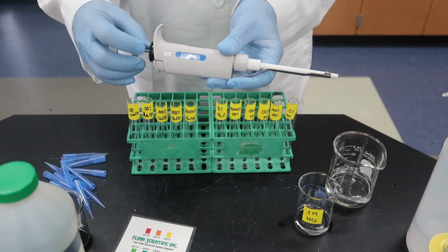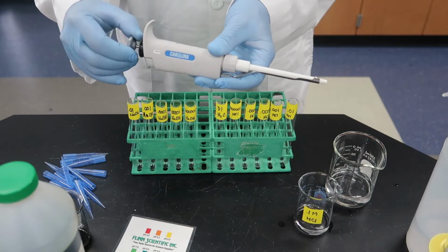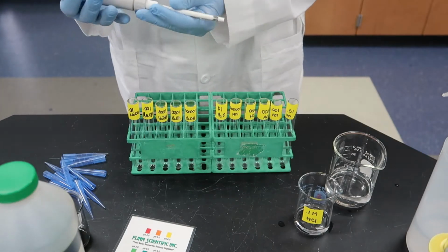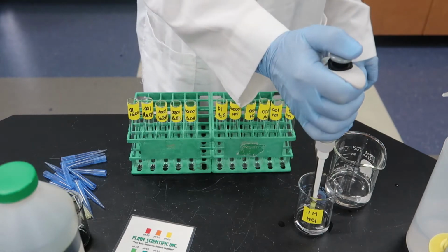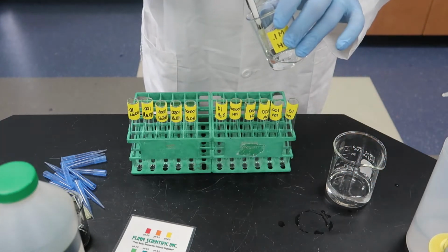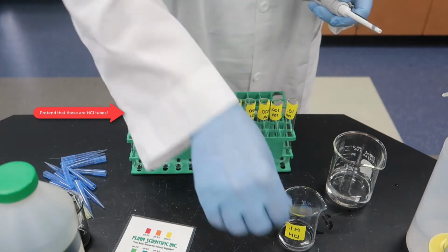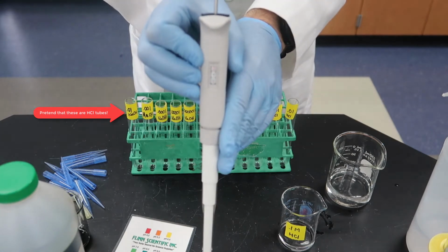And I'll show you the procedure, but again, I apologize for the mistakes on the labels because I did not have them facing me, which you should always have when you're working with labeled test tubes. All right, I've set the micropipette to 100 microliters. 100 microliters, that is a tenth of a milliliter. And I've got my tip, and we are going to extract 100 microliters from our starting solution and add that to our first test tube that should say 0.01 HCl, not NaOH. So again, for the rest of this video, please pretend that all of those NaOH tubes are correctly labeled with HCl.